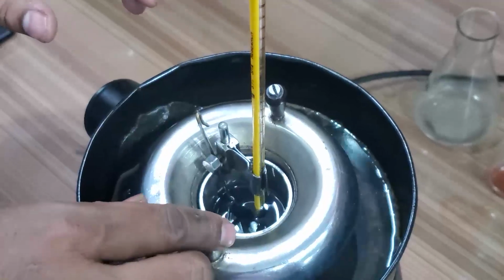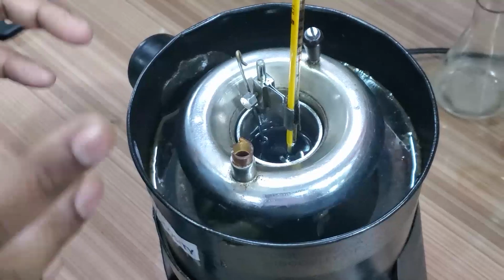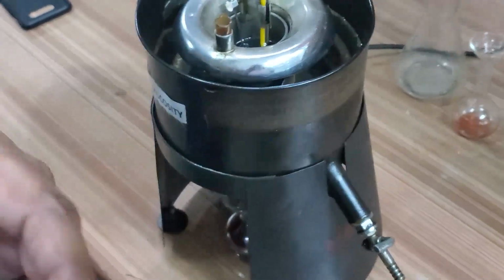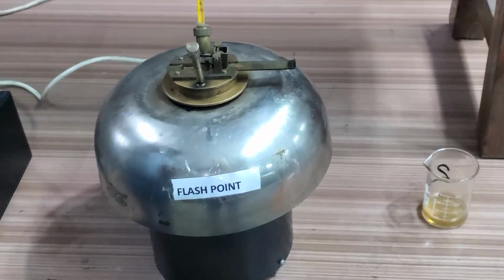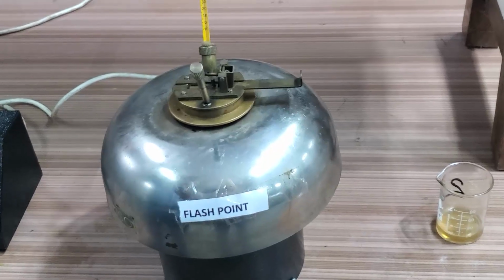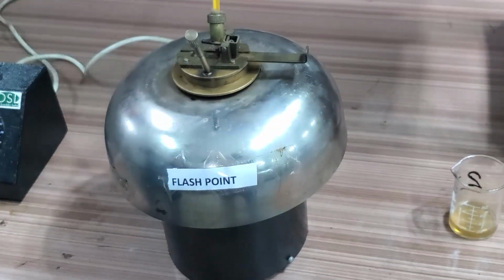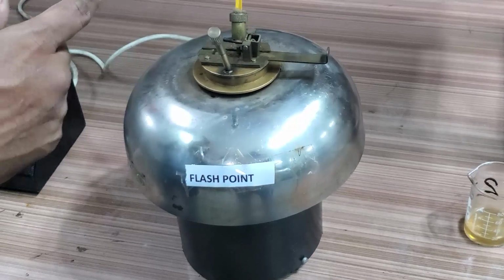So anyway, when we see the detailed experiment totally, then we'll get the idea, because we are going to do the viscometer test and the flash point at different temperatures. Suppose 75 degrees centigrade is the flash point you got, where the flash first came. Then we have to repeat the experiment again. Next time, you take out that oil, put in fresh oil, and test again from 70 degrees onward, 70, 71, 72, 73, to get the accuracy of the flash point.